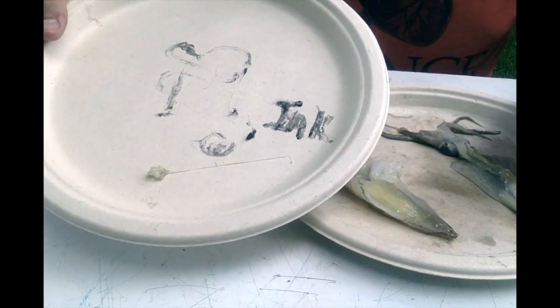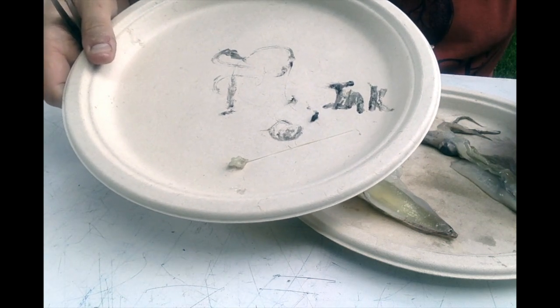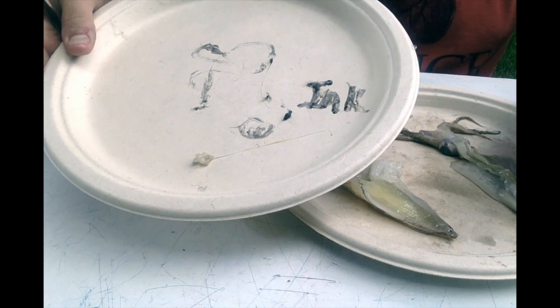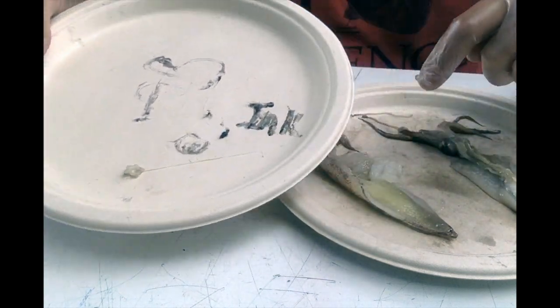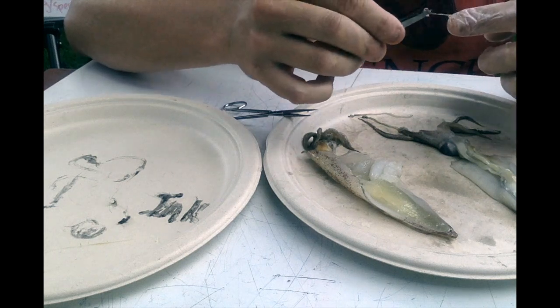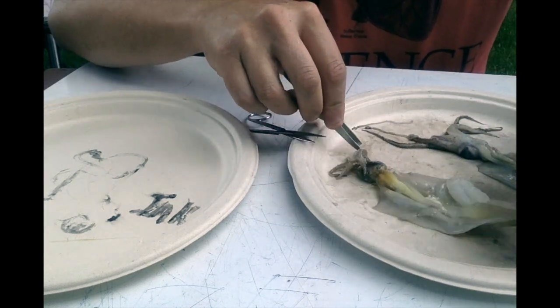If you're interested in the brain and how it works, axons, dendrites, and the interconnections between those different cells and those communications and electrochemical signals is really how brains work, in humans and in squid. And that is a squid brain, and that is this long nerve cell or axon that's connected to it. All right. Got the brain, got the beak.